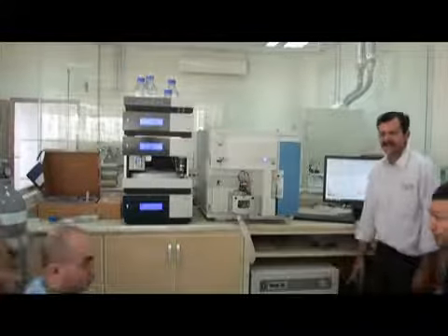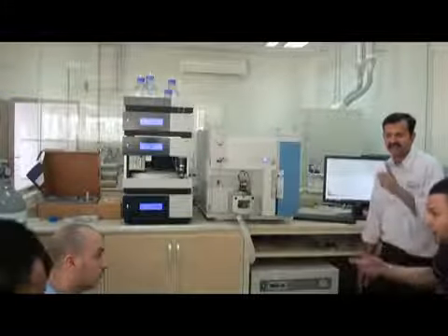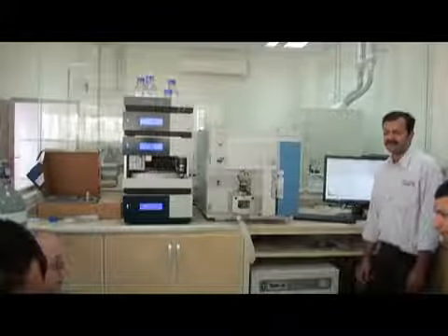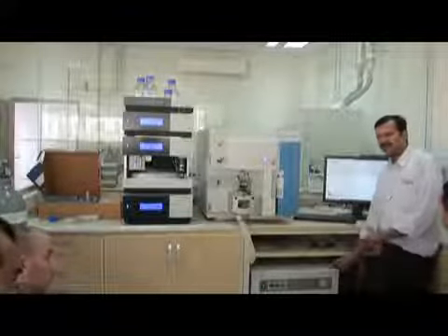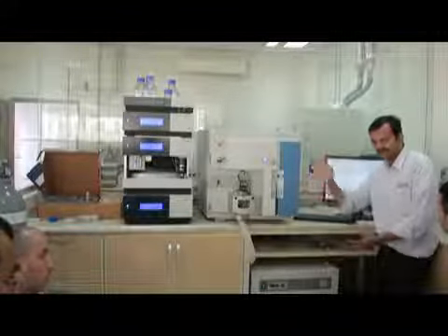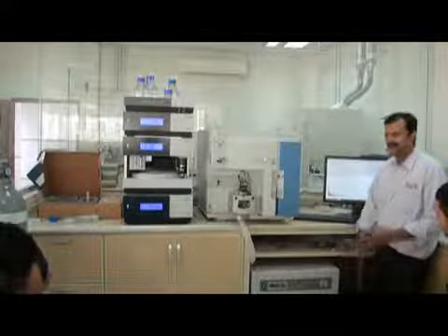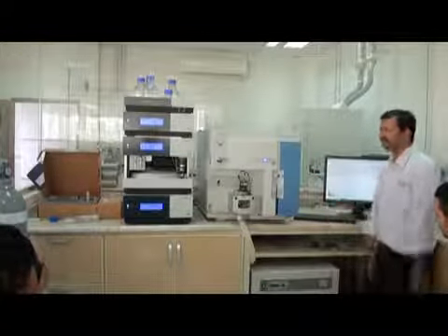The pressure of nitrogen is normally around 90 to 100. It should always be above 90. Ideal it should be 100, 100 psi. Because this is automatic, when the pressure is utilized, the pressure goes down, the compressor again starts, and it will again pressurize to 100. You will see this time to time on, then off, then on, then off. Right now it is not becoming on because the gas is not used here. That's why.